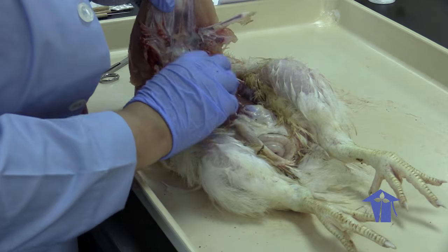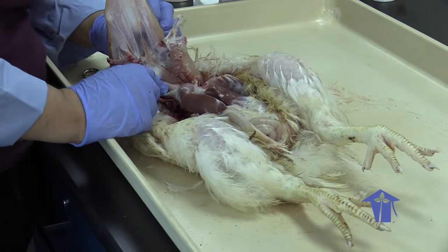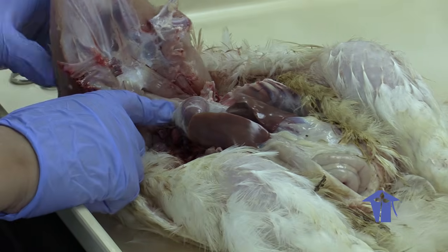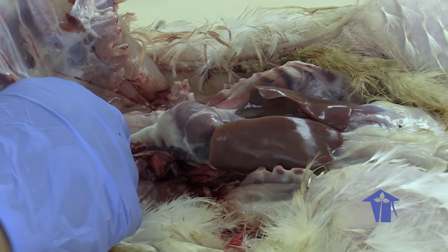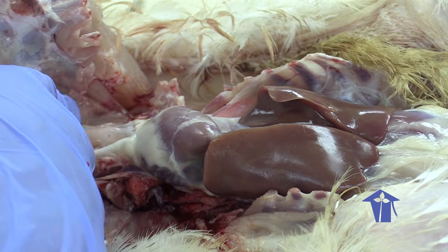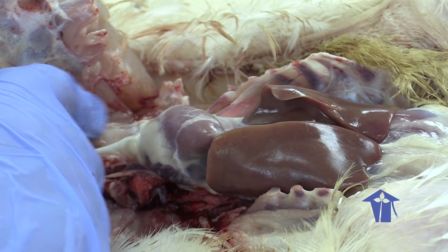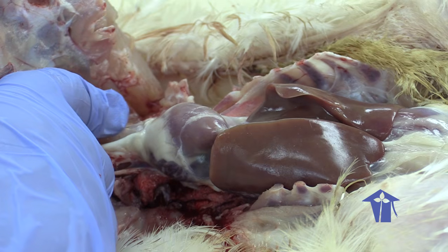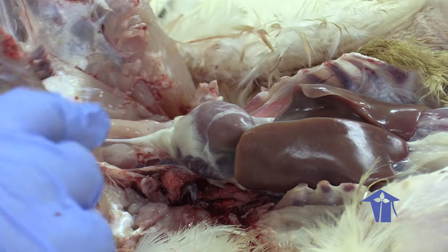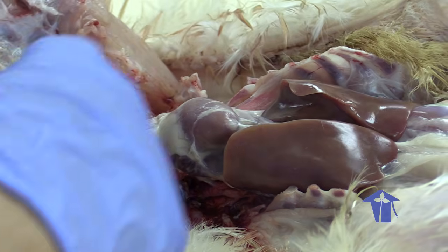If we look here, this is where the trachea is going to be branching to the lungs, right? This kind of ridge structure we're seeing, remember the trachea is supported by cartilage rings, and it has a kind of ridge, you know how a washing machine hose or a dryer hose feels, fluted and ridged. That's what it feels like.